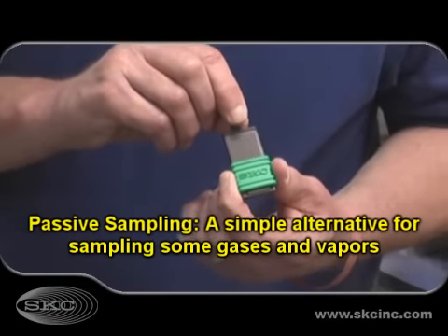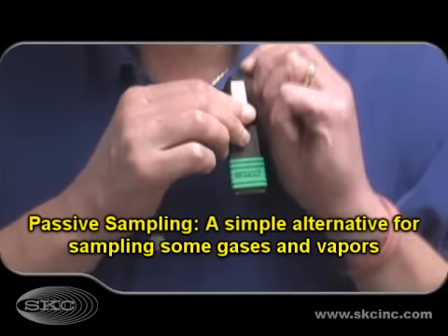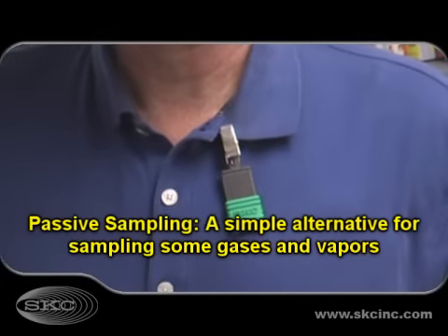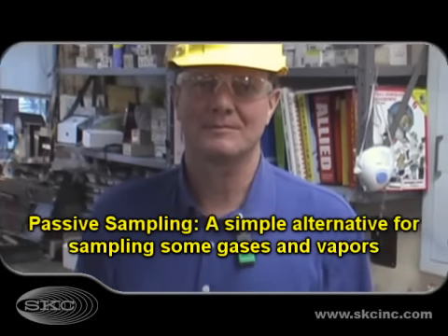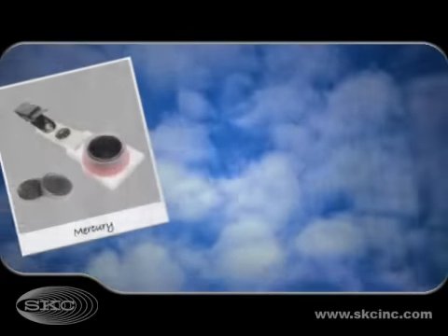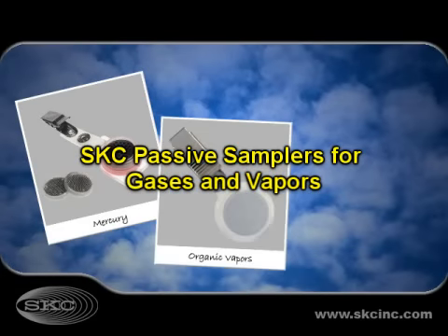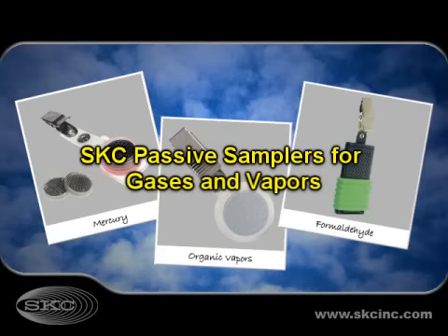Passive sampling is a simple alternative for sampling some gases and vapors because a pump is not required. The worker simply wears a small, badge-like sampler that collects airborne chemicals by diffusion. SKC provides passive samplers that have been scientifically validated to ensure reliable sampling of target compounds.